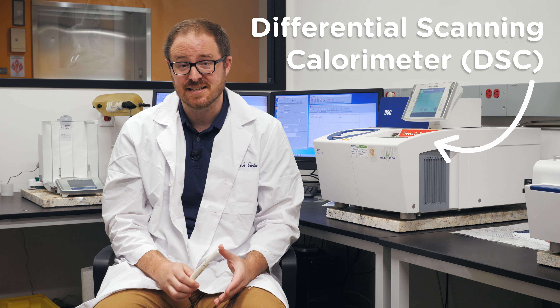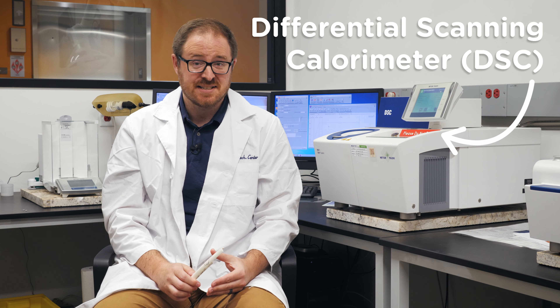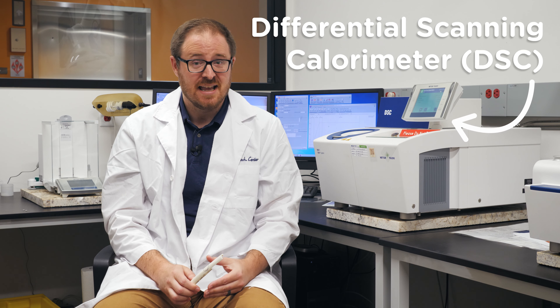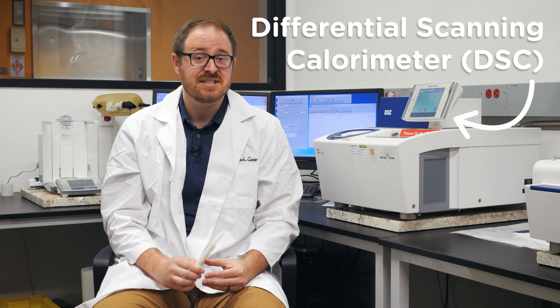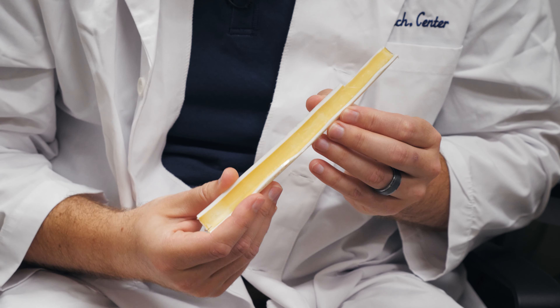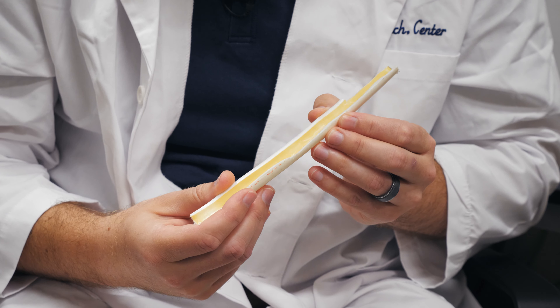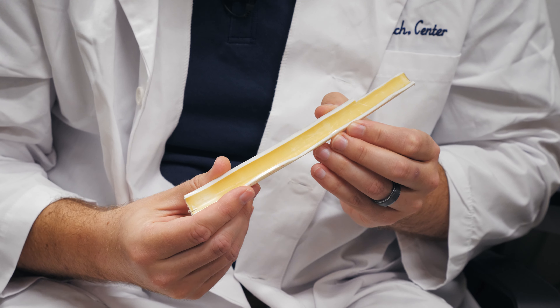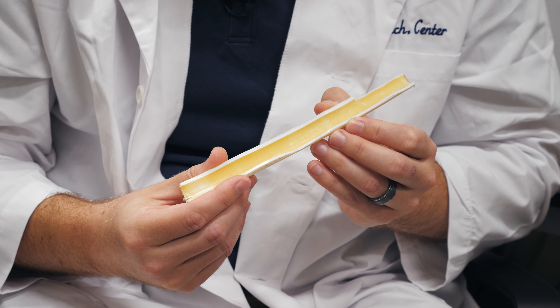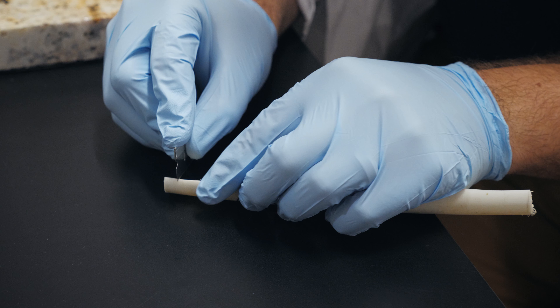One instrument that we utilize for analysis of pipes or plastic is the Differential Scanning Calorimeter, or DSC. What the DSC does is it measures heat flow into a material, and this allows us to identify fundamental physical characteristics of this material — for instance, the degree of oxidation that has occurred in a pipe or plastic.